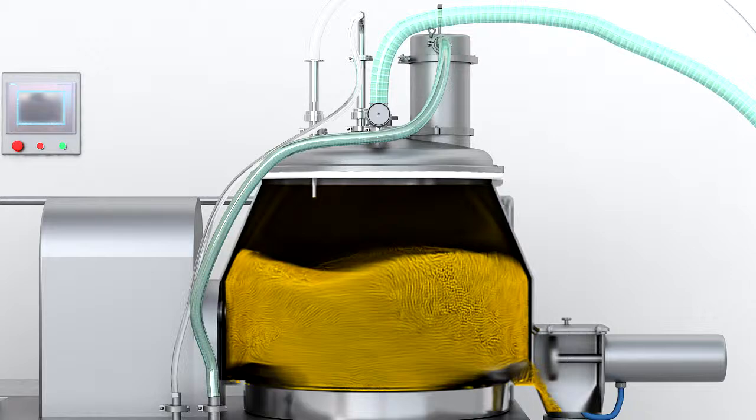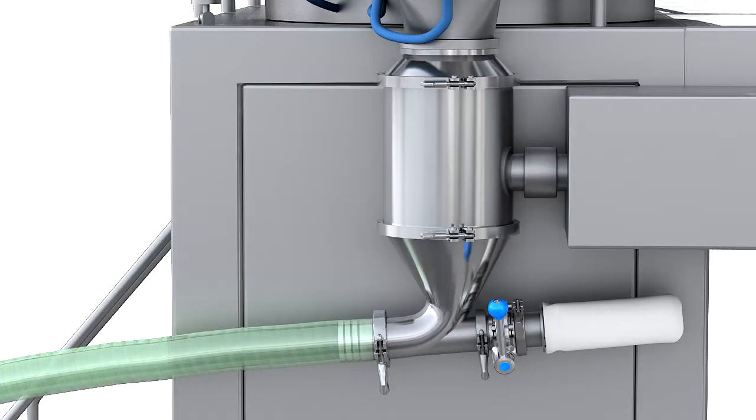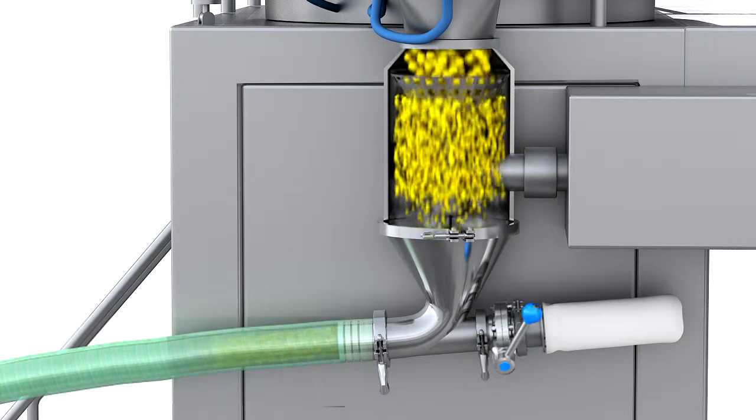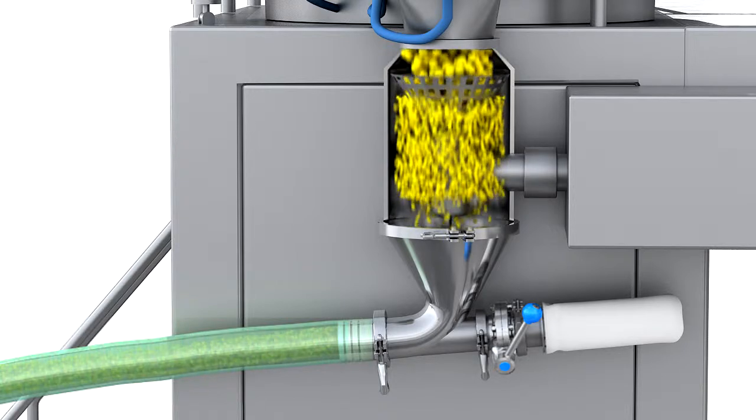After finishing the granulation, the discharge door opens. The impeller, controlled by an inverter, rotates intermittently and slowly. The wet granules are exhausted from the container into the wet cone mill. The wet granules are milled by the rotating blade to form even granules and exhausted out.